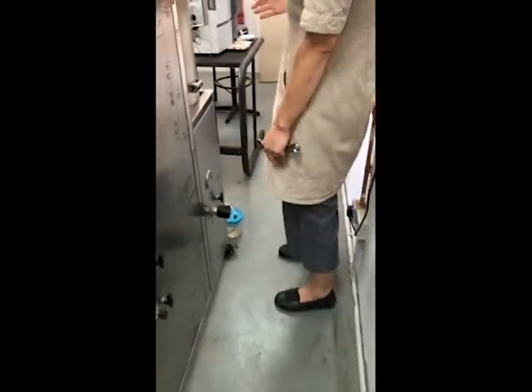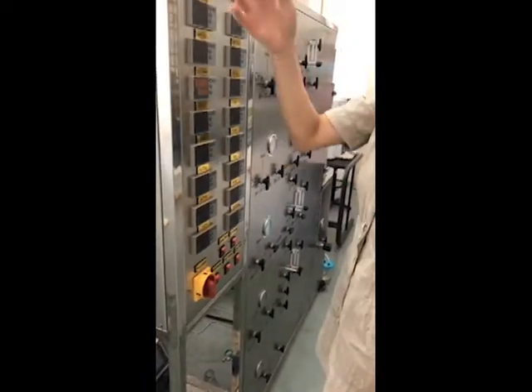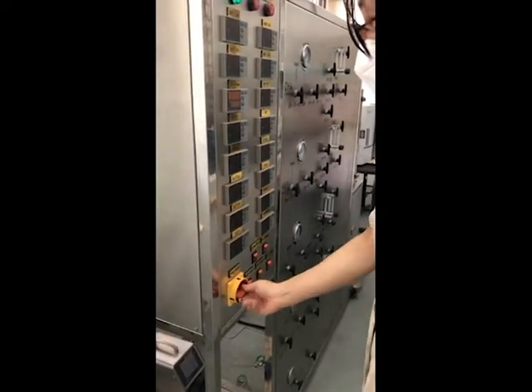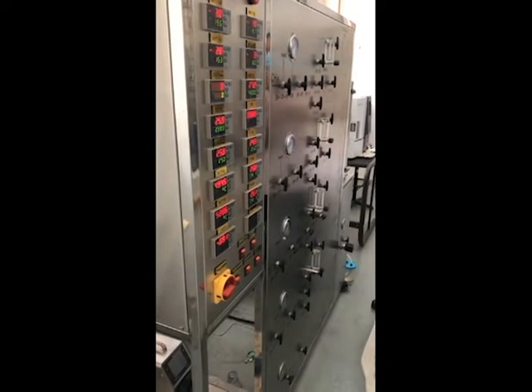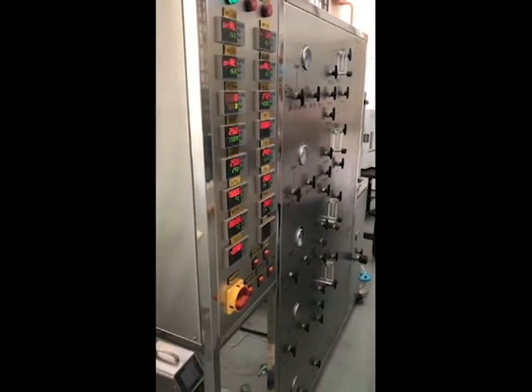One is to forbid giving out flammable gas inside the room. Second is enough exhaust for protection. Now after you prepare the exhaust and the output gas is ready, you can start the reaction system. Let the system do auto checking. If any error happens, it will tell you.